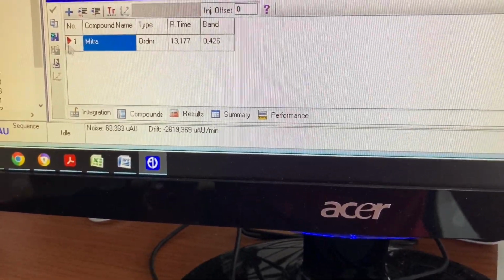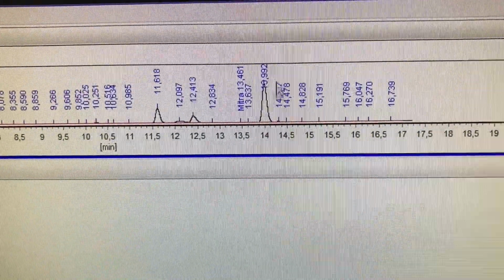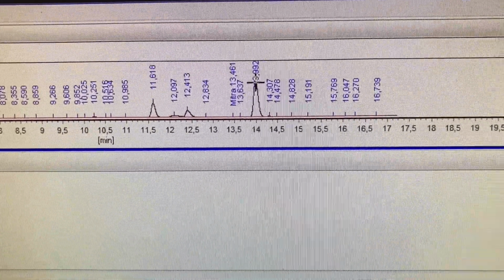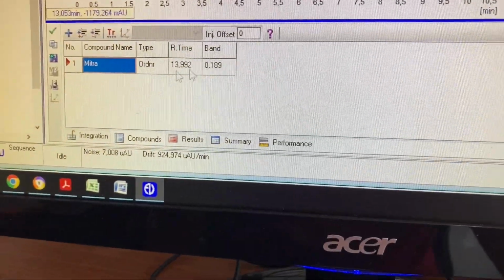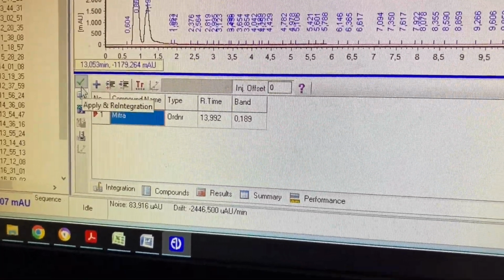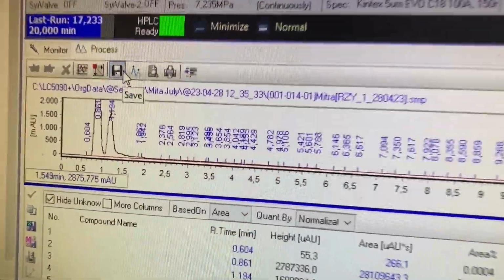Now we want mitra to be marked on the graph. So highlight, see, can you see? I just highlight on there, there'll be a cross, double click on that. And then the exact readings here, push save, save, and save here, yeah, save there.